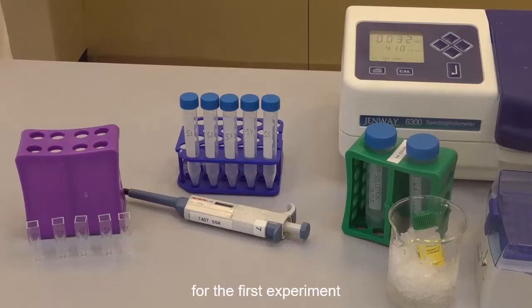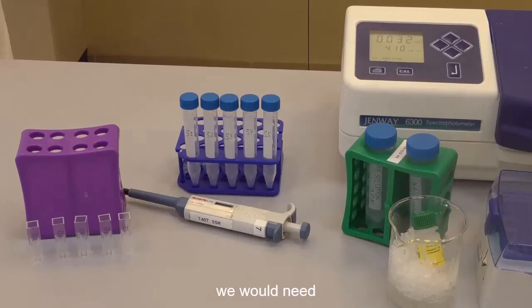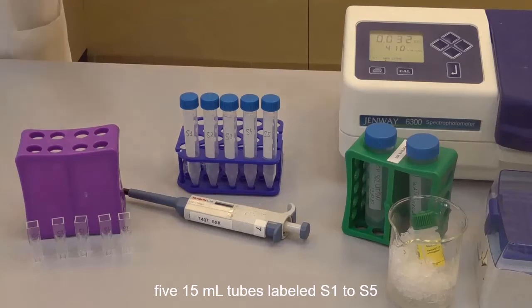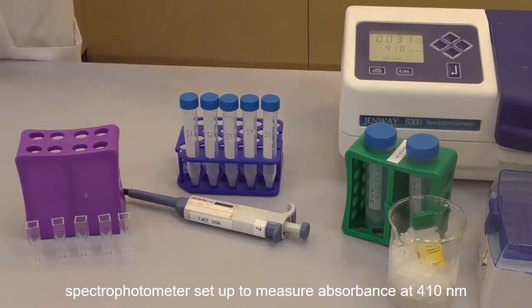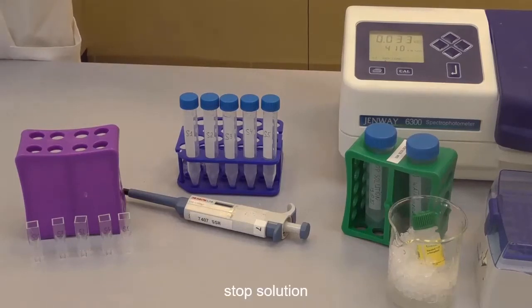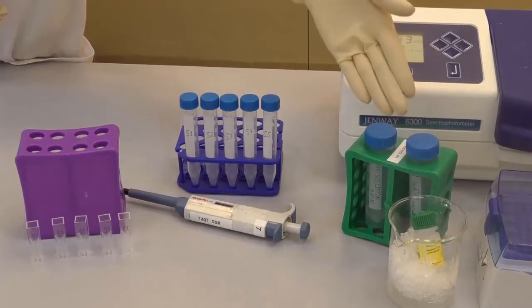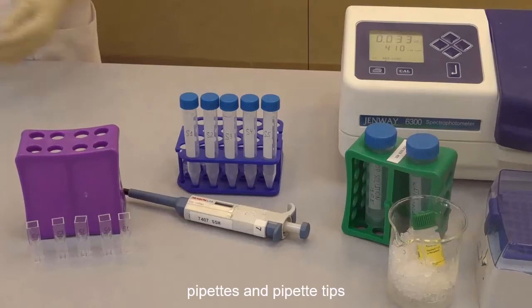For the first experiment, in which we are going to build a standard curve for p-nitrophenol, we need 5 spectrophotometric cuvettes, 5 15 ml tubes labeled S1 to S5, then the spectrophotometer set up to measure absorbance at 410 nanometers, the stop solution, DI water, and p-nitrophenol. We will also need the pipettes and pipette tips.